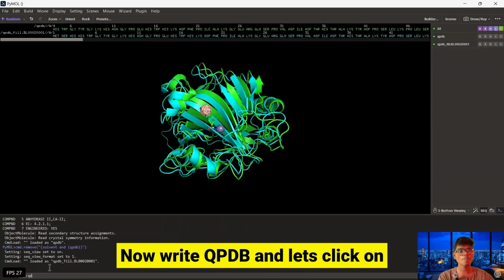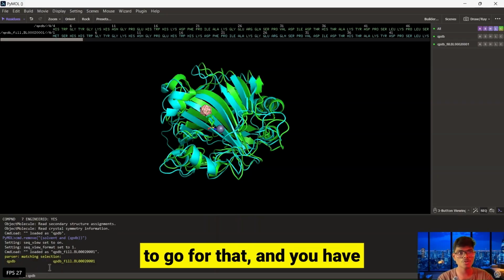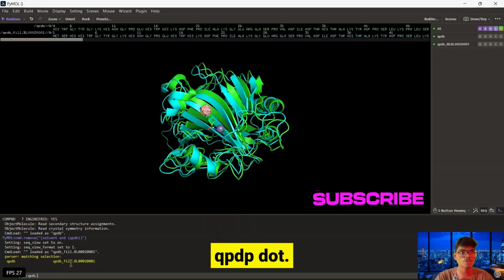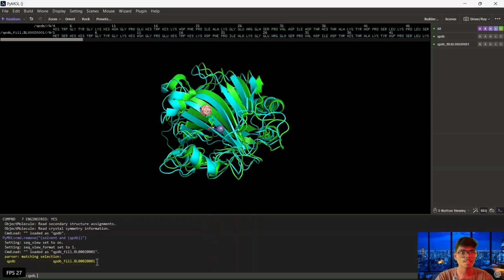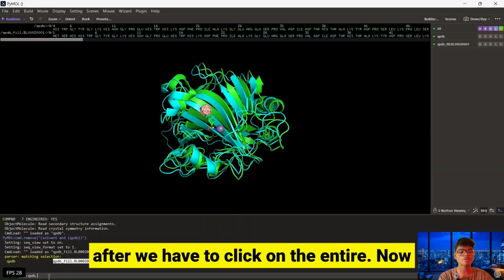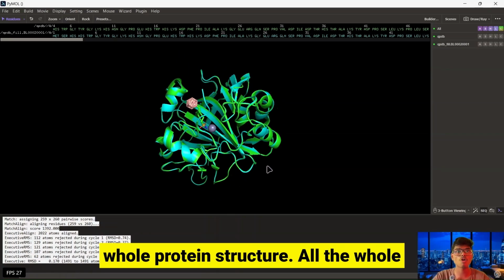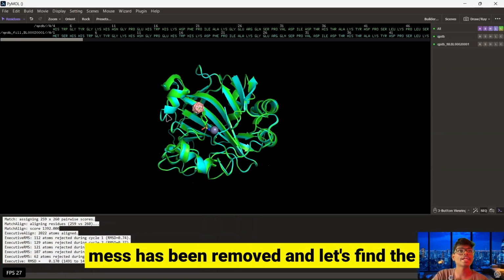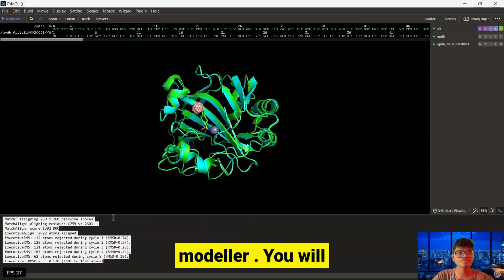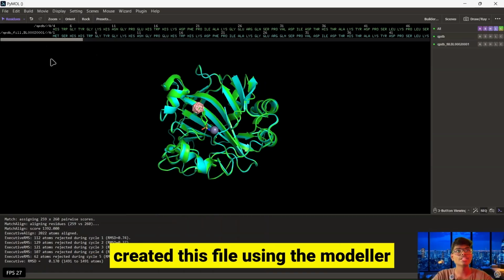Now write QPDB and press tab, and then a comma, and you have to write this file name. This is QPDB. We have to copy this content, and then click on enter. Now clicking on enter, you will find the whole mess has been removed. And let's find the difference over here. You will find the difference, as we created this file using the modeller application.